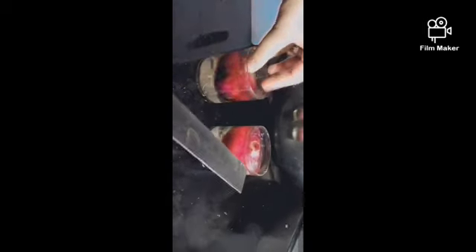And let's put it back. Now let's measure the length of jar B onion bulb root — its measurement is 3 cm.